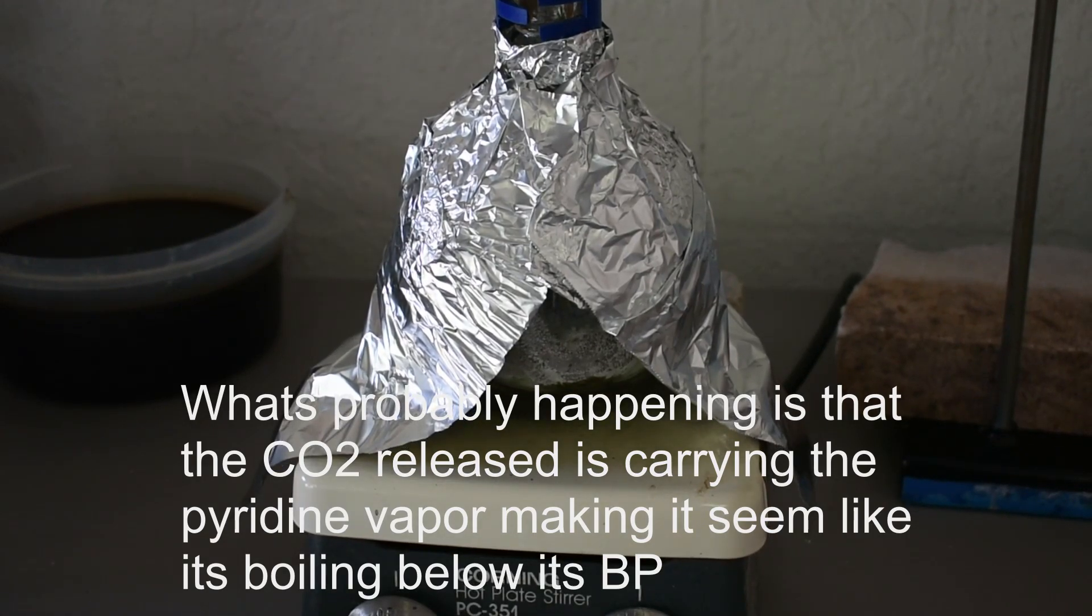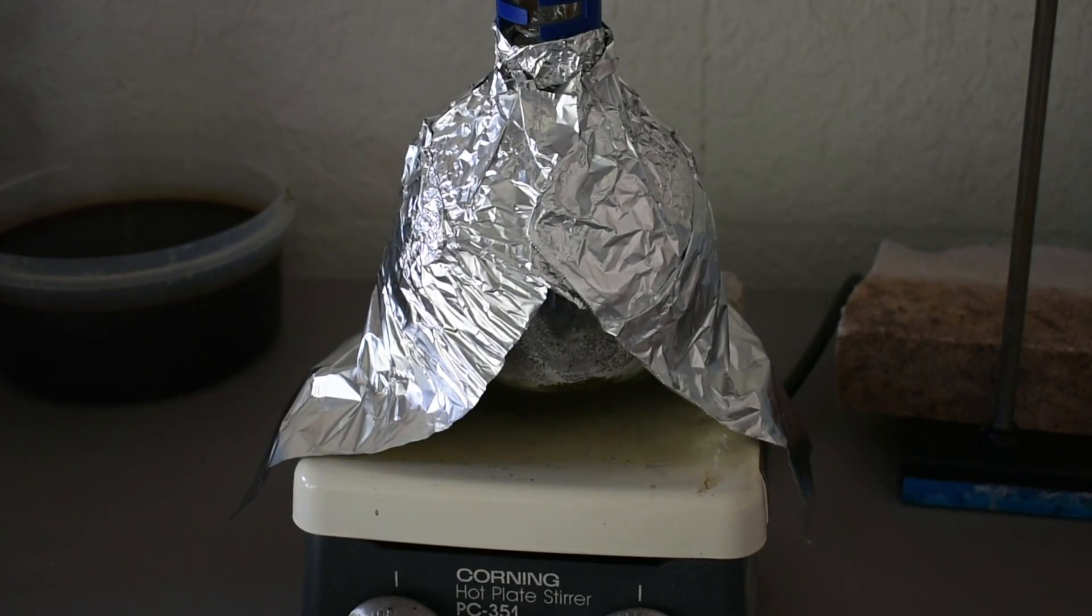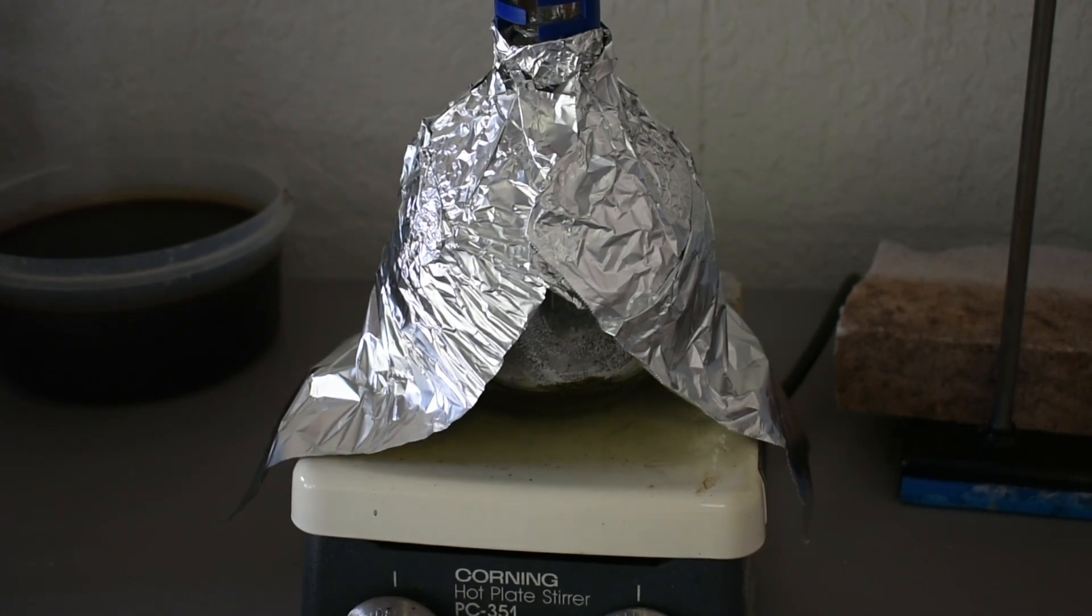That could just be some pyridine contaminated water. But nonetheless, the temperature should eventually rise up to the boiling point of pyridine once all the water gets out. Just a quick update: still stinks, of course.